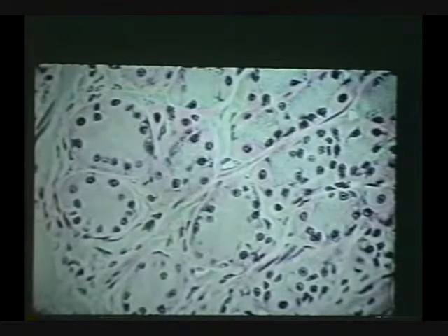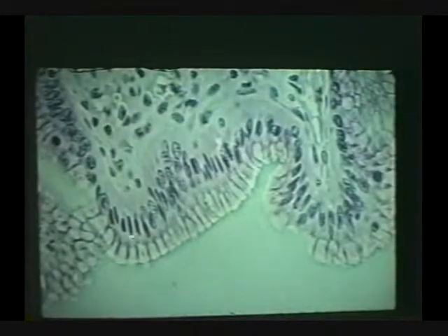We're looking at stomach again. Tissue? Simple columnar. Okay, cell? Goblet. This is all mucus producing. One of the names they call these are mucus neck cells that produce the mucus in these gastric pits. Okay, what kind of cells are these? Same, but they're cut in cross-section. Boy, I love it. You're getting those right now. Good job.